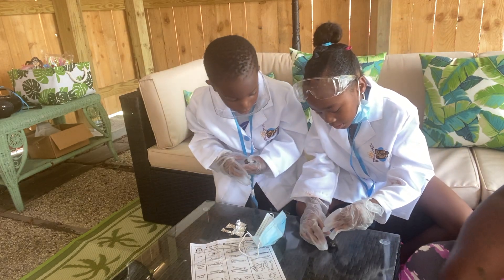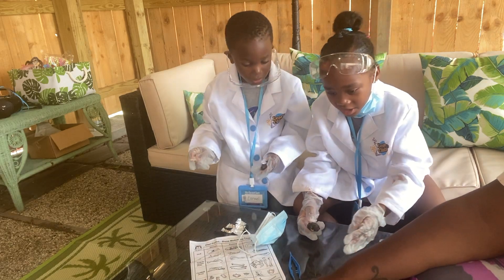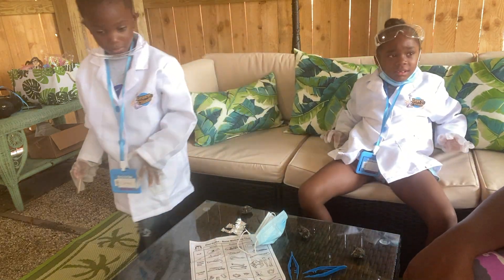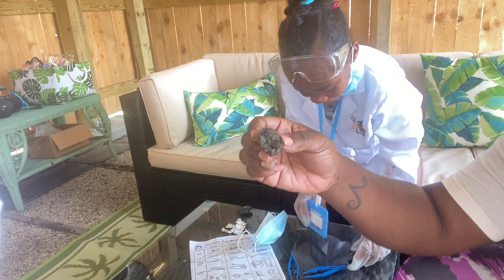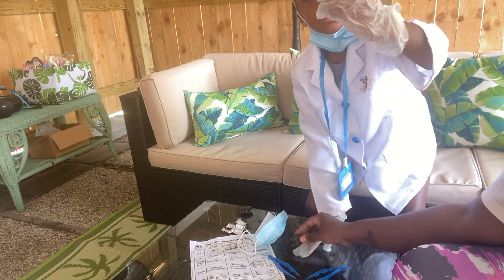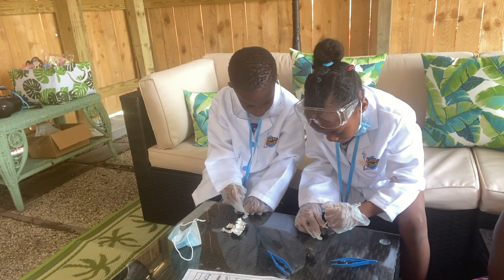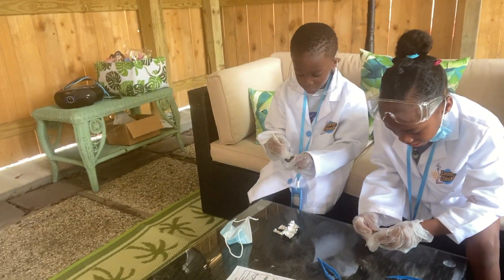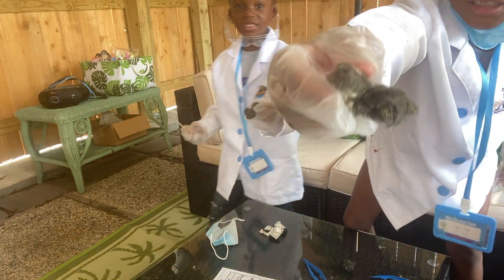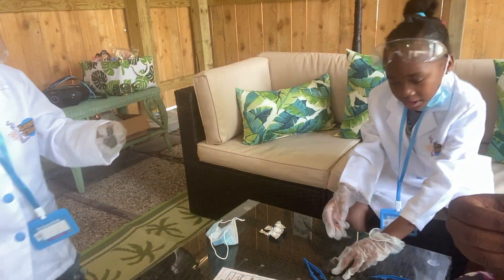Just open it up however you want. You've got to go slow, Carmela. Can y'all see that? Can y'all see this bone? Let's check it out. So let's see, we got to just dissect it. They regurgitate — what does regurgitate mean? Throw up, they spit it up. I guess I should be having gloves on, but I don't. That's nasty. This is gross.